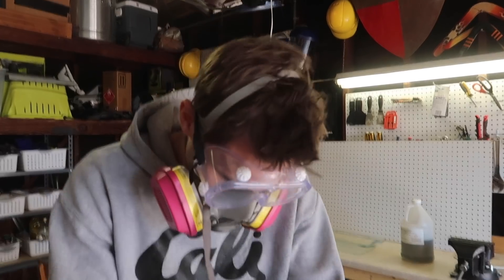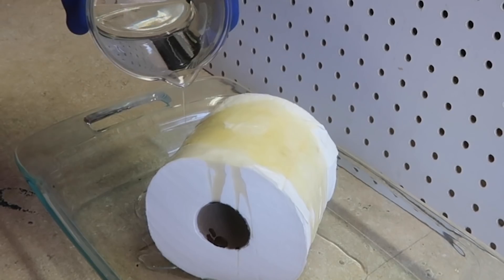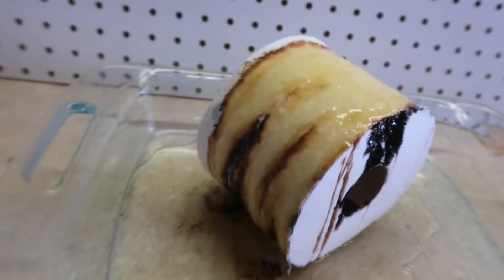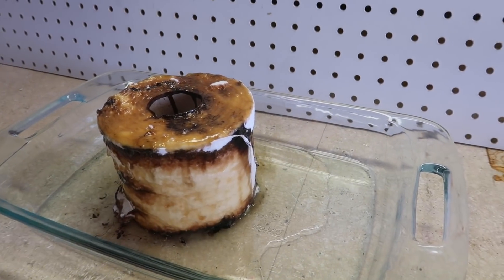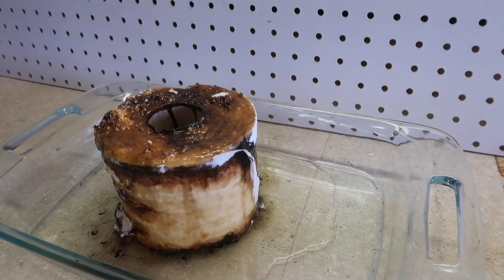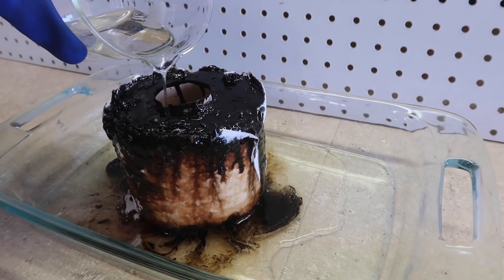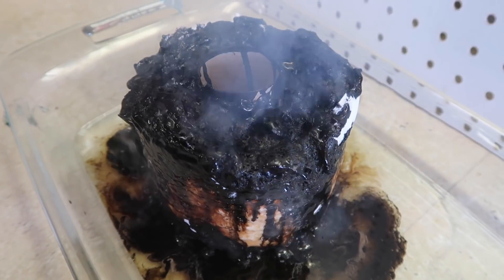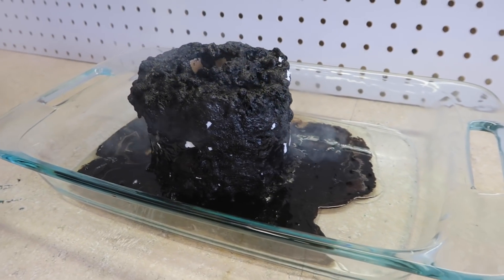I do like Charmin — it is the best toilet paper brand. Oh, this side's looking gnarly. Wow, that's just going. Oh, look at it go. That's wild. It's doing so much — it's so crazy, that's insane. It's burning the crap out of it. It's just melting the toilet paper into a black goop.